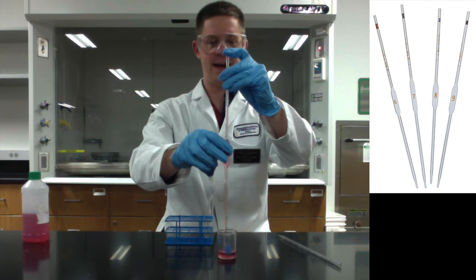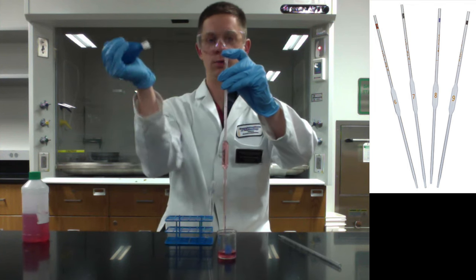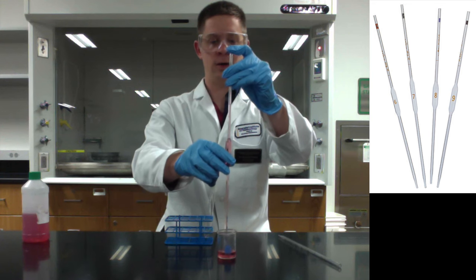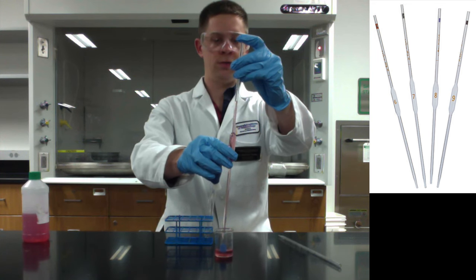So I almost did that too quickly to notice, but as soon as it's above the line at a level you're comfortable with, remove the pipette bulb and place your finger over the top. That'll prevent flow down the pipette. From here, you can gently let up.